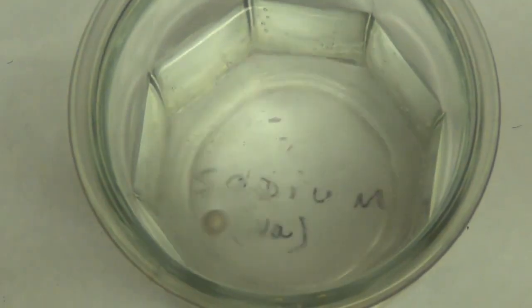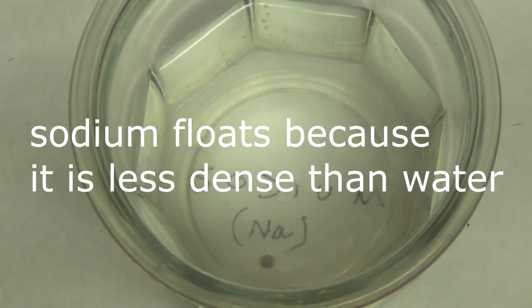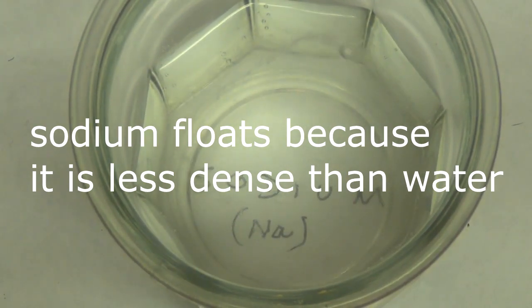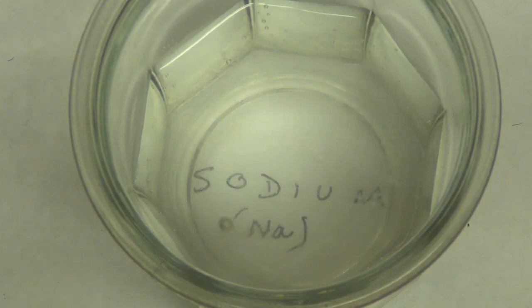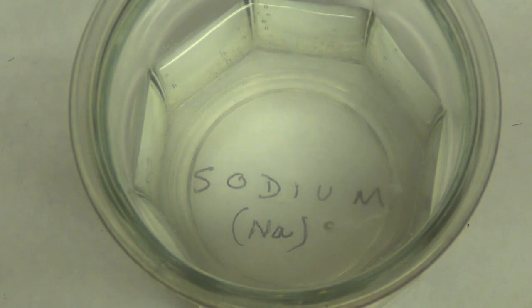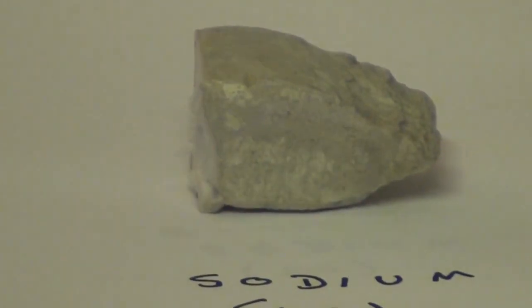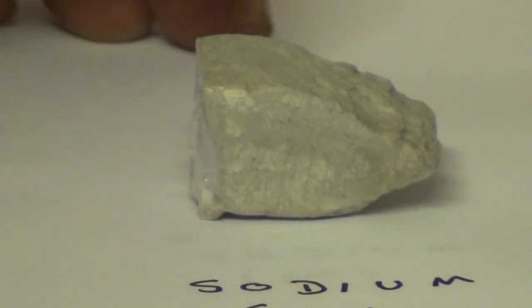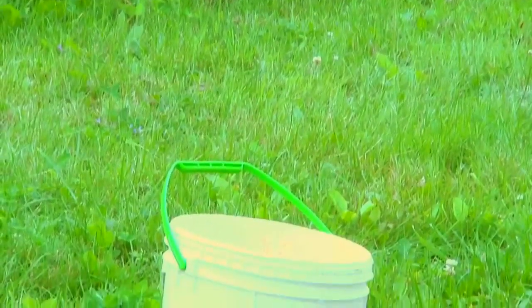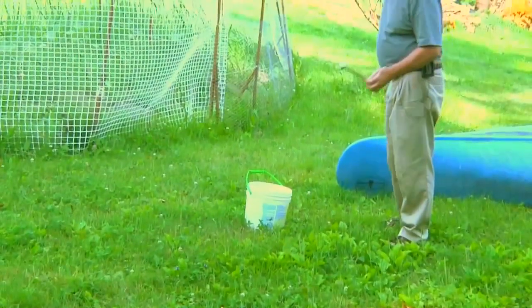To show you how reactive sodium is, we'll throw some in water and show you that it actually reacts with water and becomes what we call sodium hydroxide. Just to show you exactly how reactive sodium is, I'm going to take a piece as big as we started with and throw it in a bucket of water outside. Watch what happens when I throw a piece of sodium in water with a weight so it sinks to the bottom of the pail.